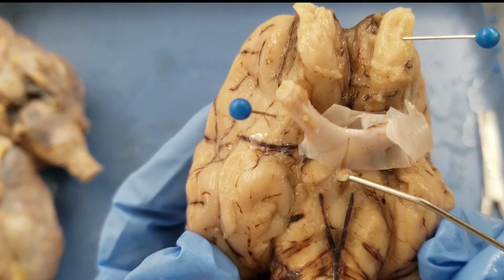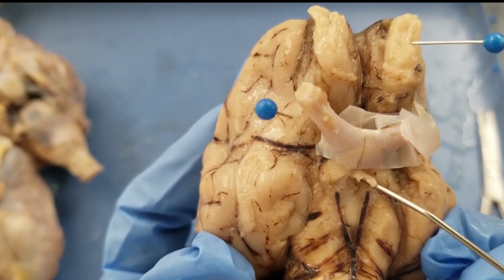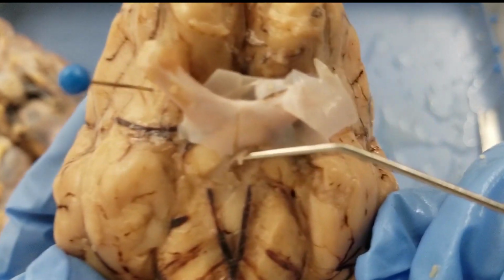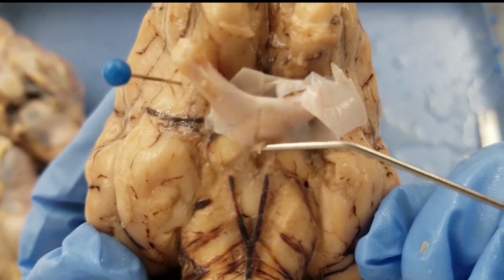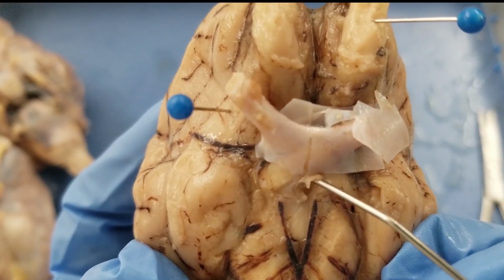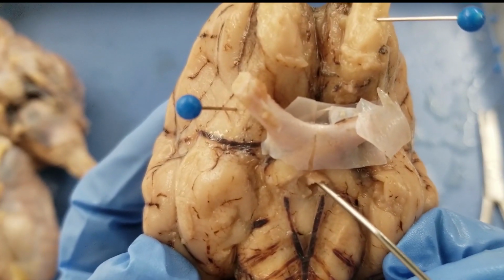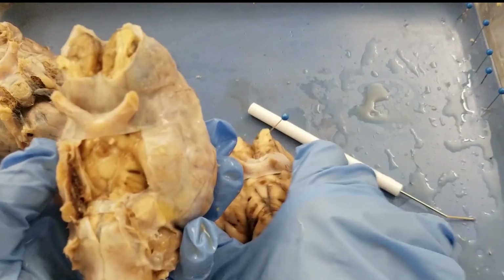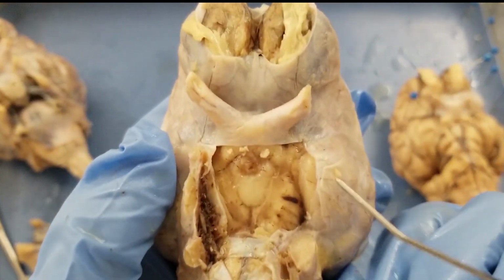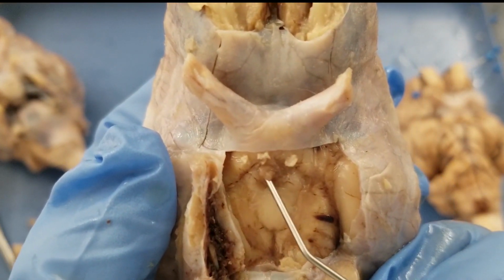Okay, so here is where the pituitary stalk was located. See, there's actually a hole in here. If I keep poking, you can see there's a hole here. And why is there a hole here? Because the hormones secreted by the hypothalamus go to the pituitary through this hole. Actually, I'm going to show you the infundibulum on this brain. That's a little bit more clear. So you see the hole here? That is the pituitary stalk. That's a hollow structure.